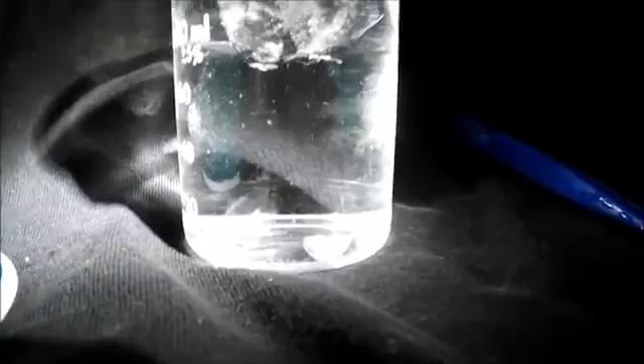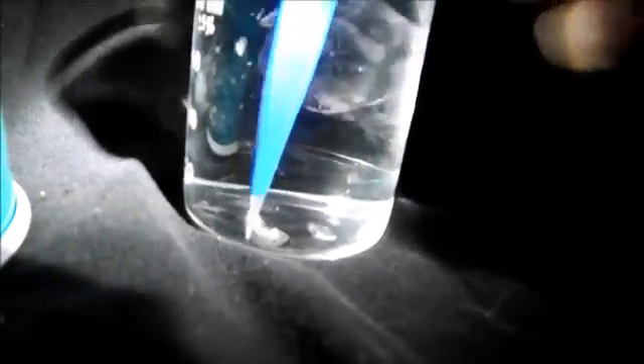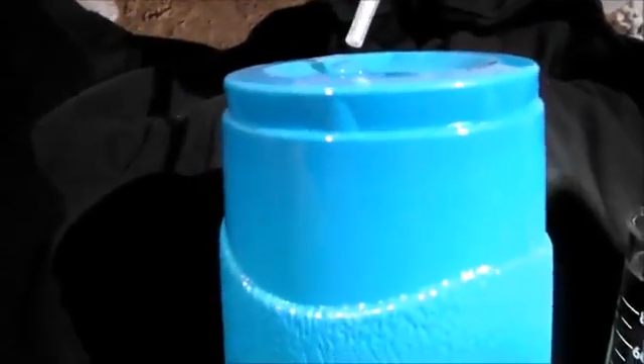Oh my gosh, I have heavy water! Let's get those out of there so we can put them back in the vial. I don't think I contaminated it that much. Since I've got this drop out and it's probably slightly contaminated, there's an experiment I've always wanted to try.